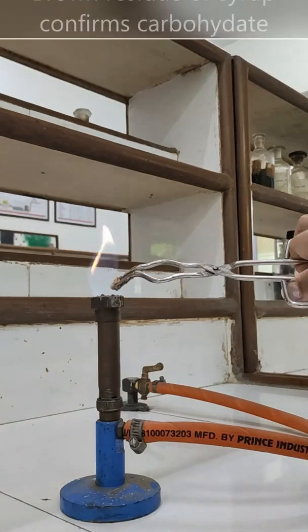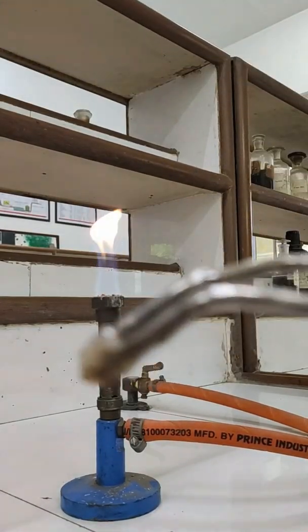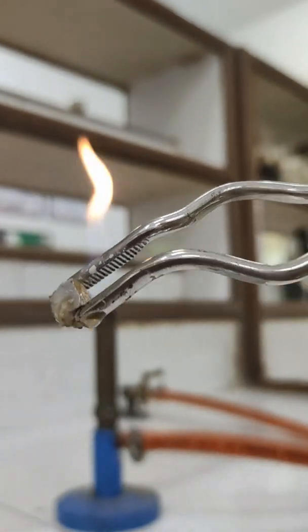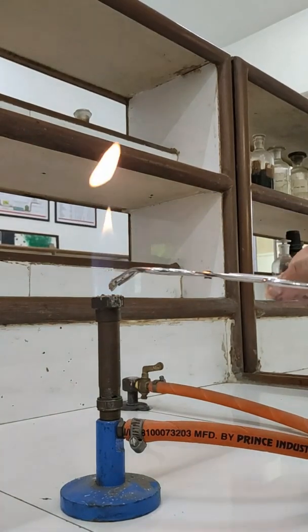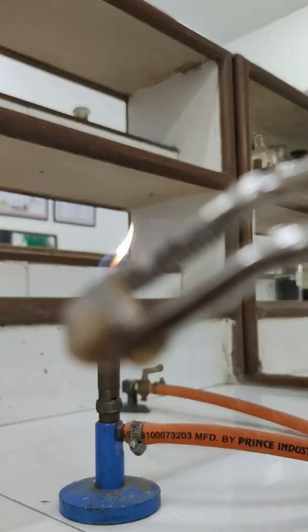Now let's check the third type of compound — carbohydrate. This will give you a brown syrupy mass. Observe: it is not giving any flame; it is a brown syrupy mass. The compound is melted with a brown syrup kind of thing. It is neither giving you sooty flame nor non-sooty flame. So this is a carbohydrate compound — like glucose, fructose, sucrose, etc.